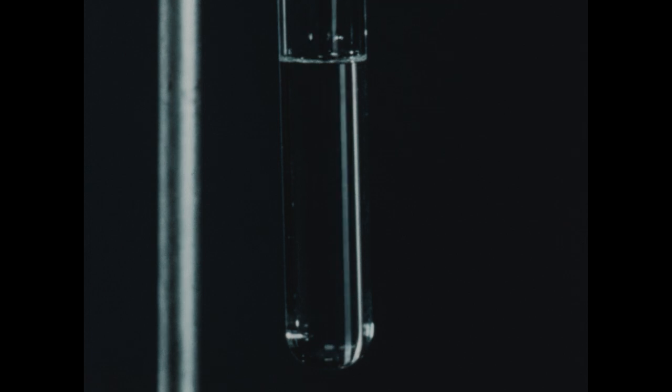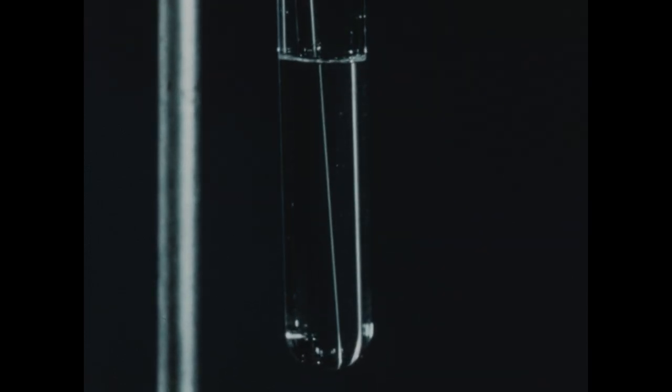A few minutes of stirring has been sufficient to cause the sugar to dissolve completely in the mixture of alcohol and water. This solvent system is not as good a solvent for sugar, though, as water is alone. It's useful sometimes to have a solvent in which the solute is not too soluble. Such a solvent is useful for purposes of recrystallization, for instance. And if the correct solubility characteristics cannot be found using one solvent alone, the chemist often employs mixtures of 2 and even 3 solvents to achieve a system which has the properties he desires.